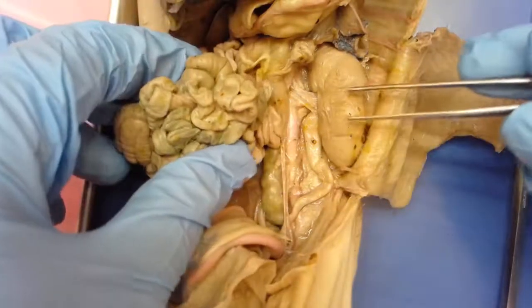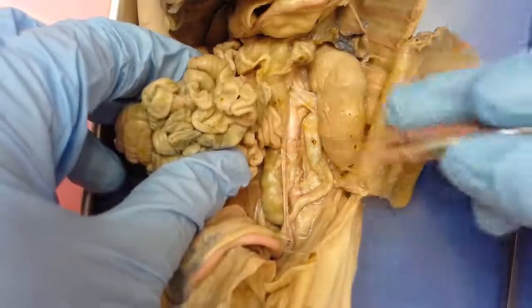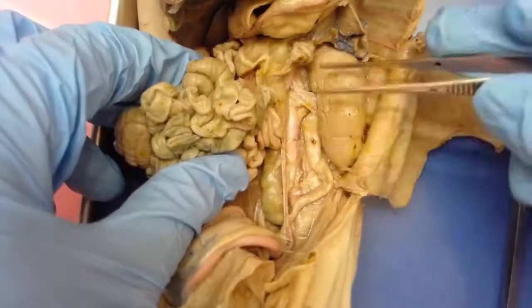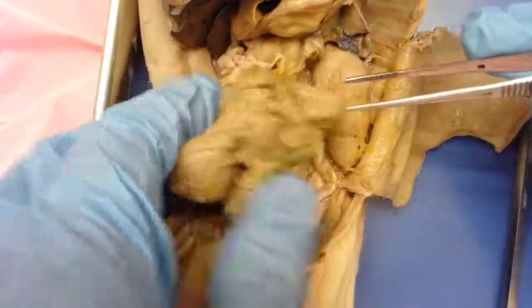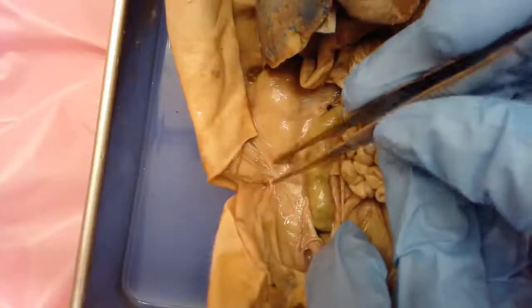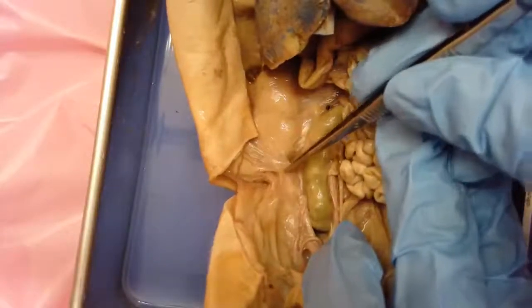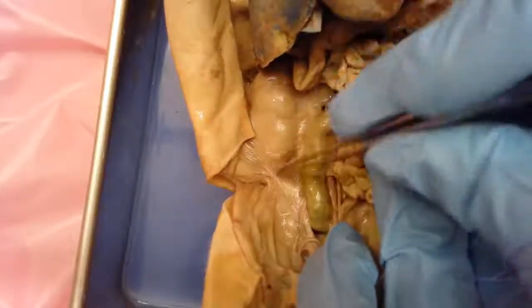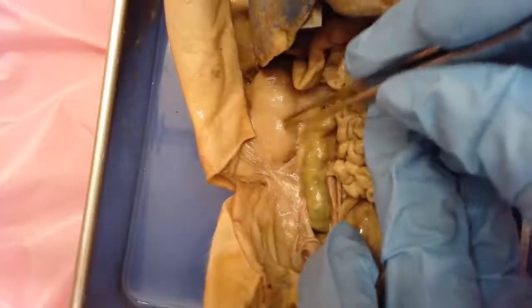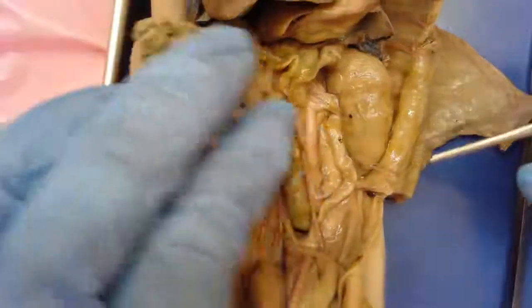Retroperitoneal means that the kidney is covered by a membrane called the peritoneum that lines the inside of the abdominal cavity. If I move these intestines over to the side, you can see the other kidney that I did not clean up — there's a membrane covering it, and that membrane is peritoneal. Typically the kidneys are back behind that tissue and harder to identify until you clean it off.